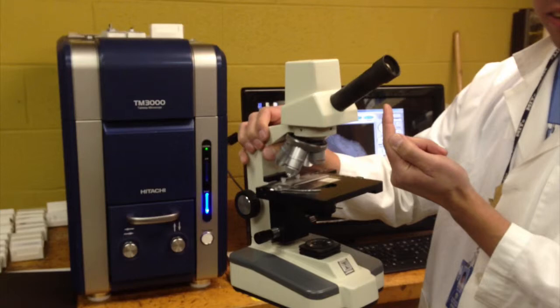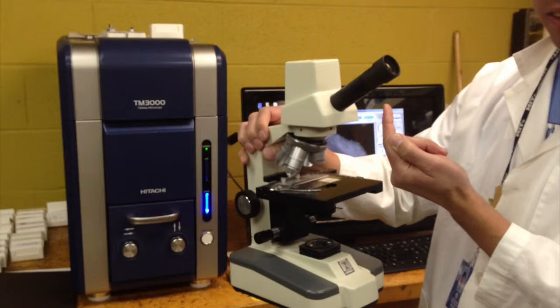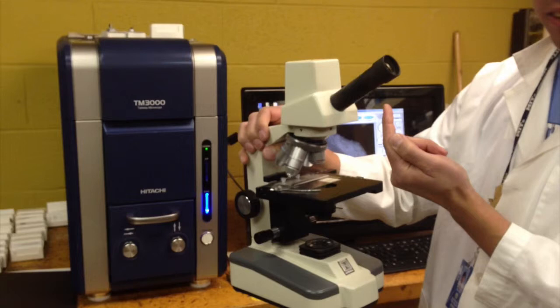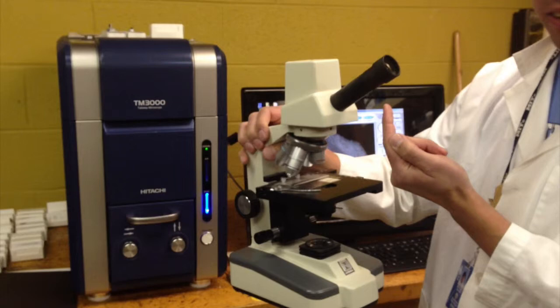This chamber is where we mount samples. Right now I actually have a rock crystal that we were able to harvest out of a device. We're zoomed in at a lower magnification, but enough to see what this surface looks like. Within seconds, we can zoom in on a surface to see what the surface of a rock or crystal really looks like. We can start to see the fractures, and if you notice this is glowing brighter, that usually means it's a different element on the periodic table — it glows differently because of the way electrons interact with it when they hit it.